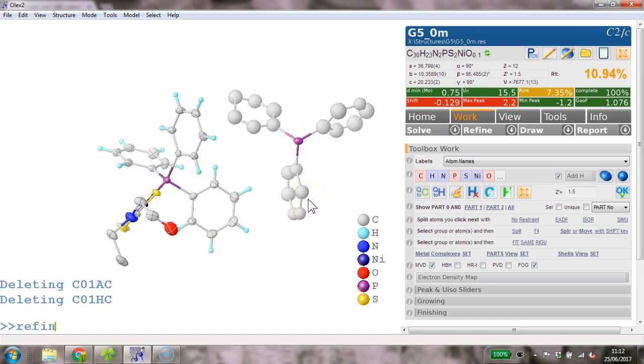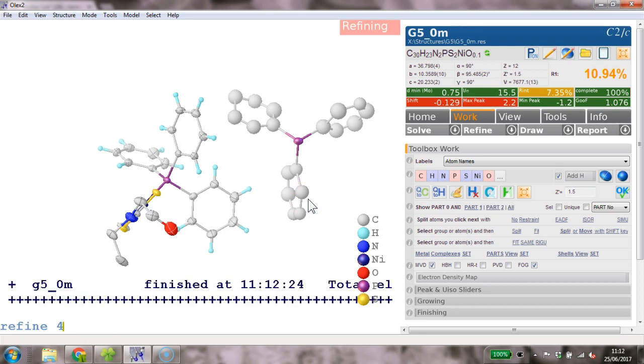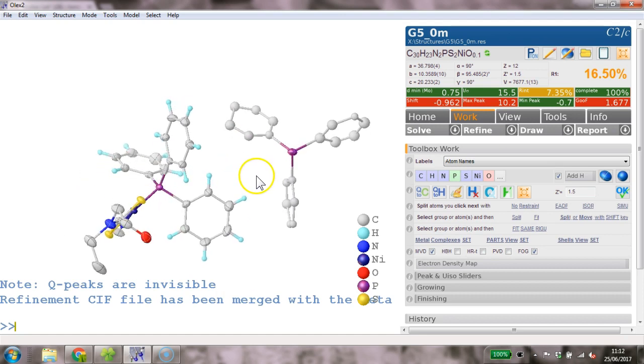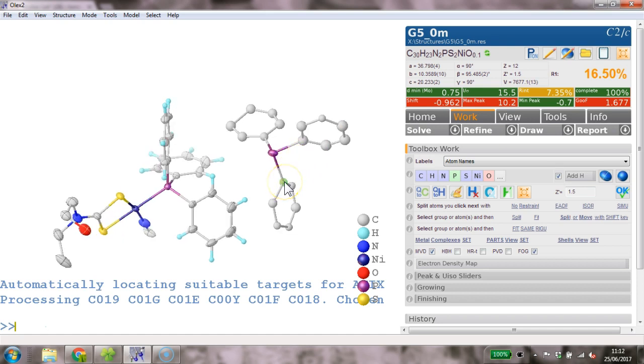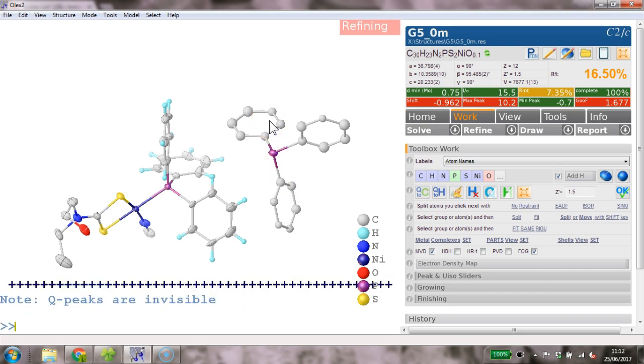I would then refine this, just gently 4 cycles, see what happens. Okay. Right, so these phenyl rings don't look too terrible. They look okay, but I'd like to have them regularized. And the way to do this is we put a constraint on, AFIX 66 on this, and also AFIX 66 on that, and AFIX 66 on that. We refine this now. These should all be perfectly regular phenyl rings, and there we are.